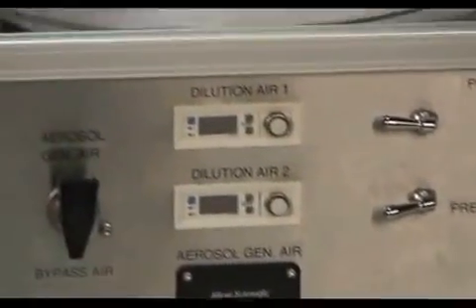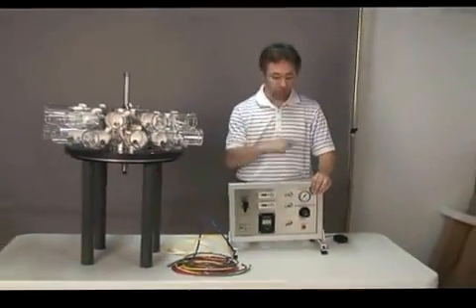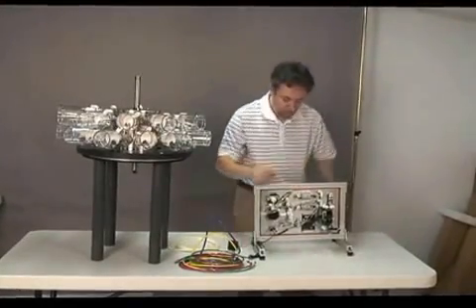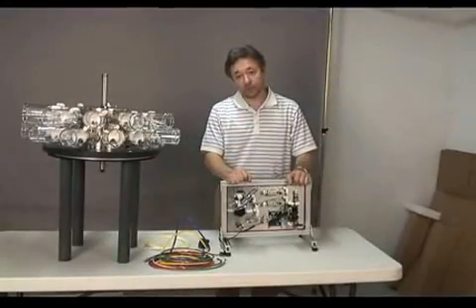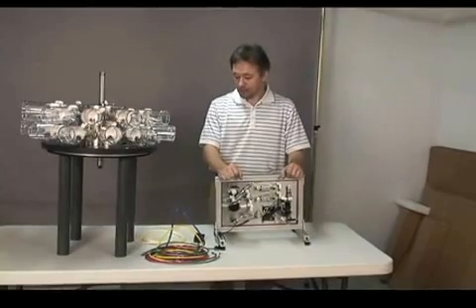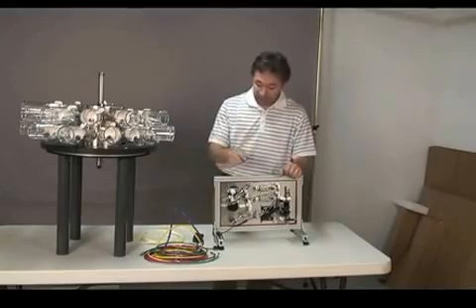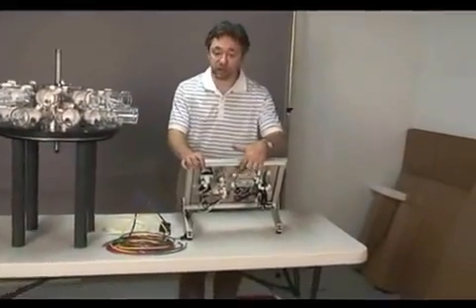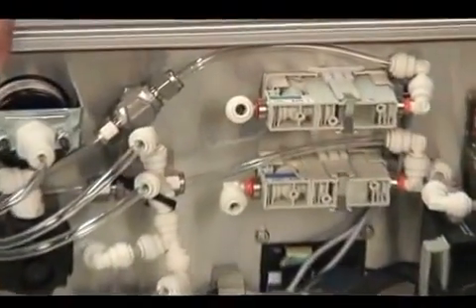Now we are going to connect the air lines of the system to the diluter as well as the vacuum pump. As you see here, all the air lines are color coded to help the user understand better what to connect and where to connect it. The same color coding is also labeled on each flow meter or outlet where the tubes are connected.